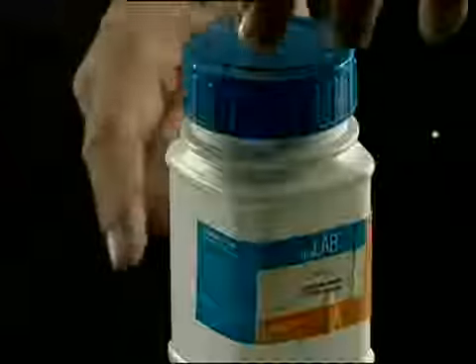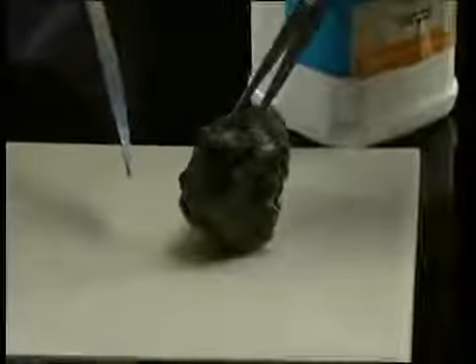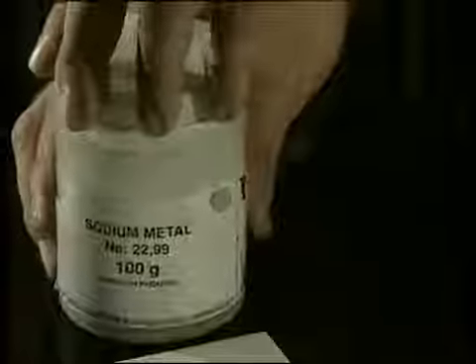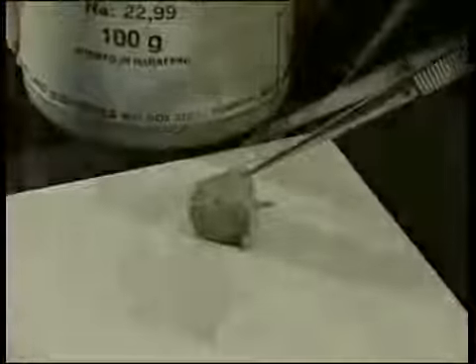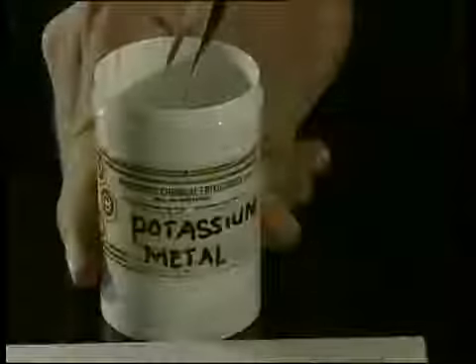In the first part of our experiment, we would like to find out what alkali metals look like. As you observe, look out for any color changes and try and estimate the softness of the metal. First, the lithium is removed from its container. Do you notice that lithium is a dark gray, shiny metal? It is also fairly hard, but can be cut with a scalpel. Next up is the sodium. Can you see that sodium is a light gray, shiny metal? It is fairly soft and can be cut easily with a scalpel. Did you also see that it goes duller very quickly after being cut?